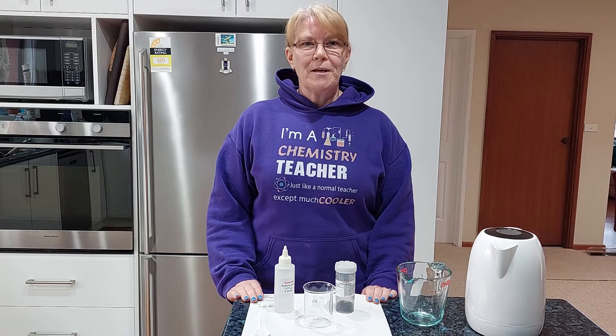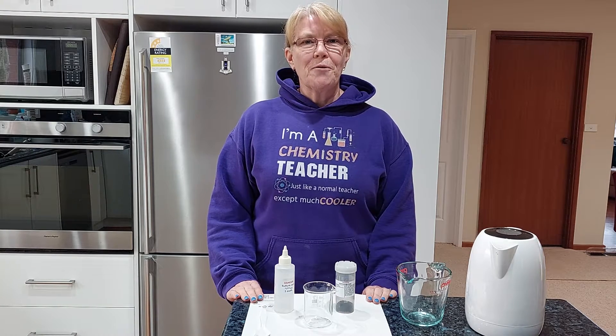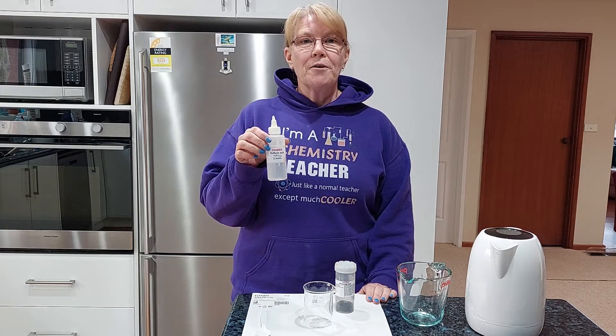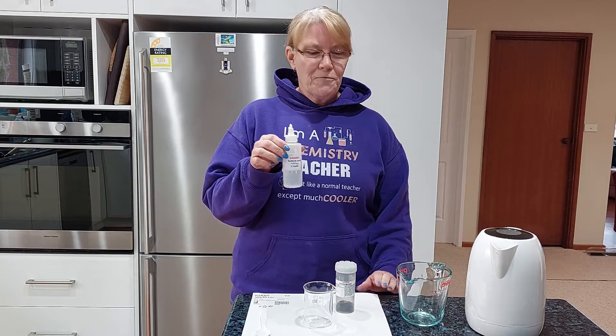Hi everyone, Mrs V here and we are back in the lockdown lab. Today we are going to be looking at the reaction between copper oxide and sulfuric acid. Now this is a cool reaction but it does tend to be a bit slow, so the first thing I'm going to do is take my sulfuric acid and put it in some hot water to heat it up, because we know increasing the temperature is going to increase the rate of reaction.